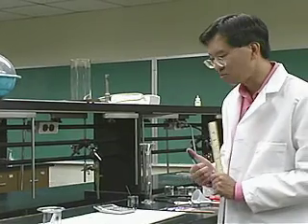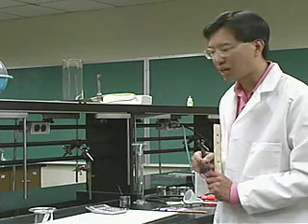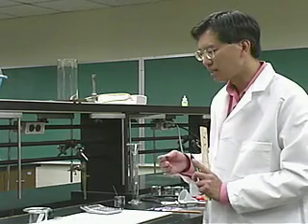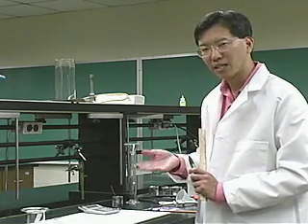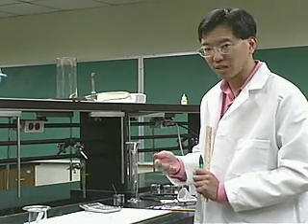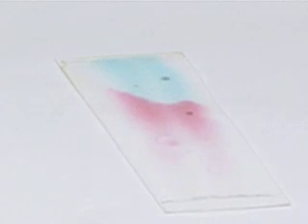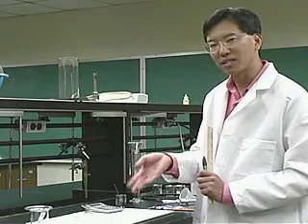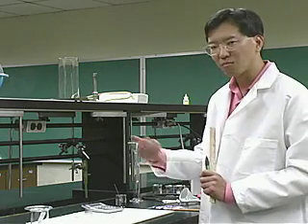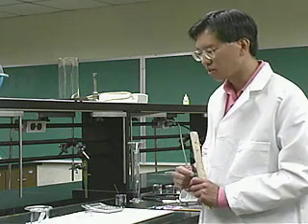Okay, now you can ask, why do they separate? Why do red and blue separate? And the answer is the molecules that make up the red dye and the blue dye have different polarities. And what we're witnessing is a competition between the affinity of the dye for the stationary phase, which is the piece of paper, and the mobile phase, which is the water. Water is very polar. The stationary phase, the piece of paper, is actually also polar as well. And depending on how well the particular dye sticks to the paper versus wanting to move along with the water determines the fact that we get different RFs for these two compounds.